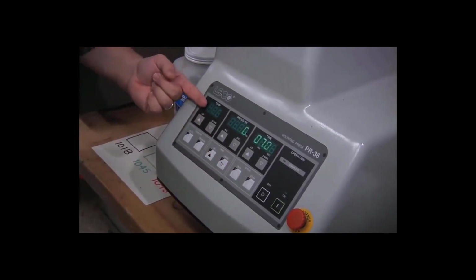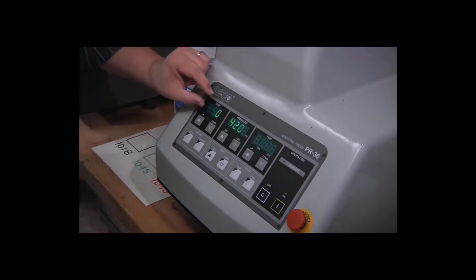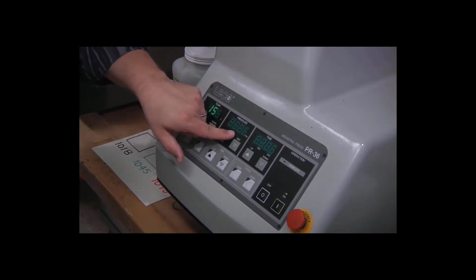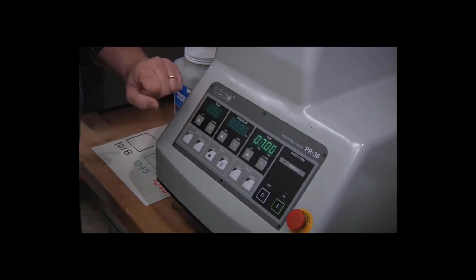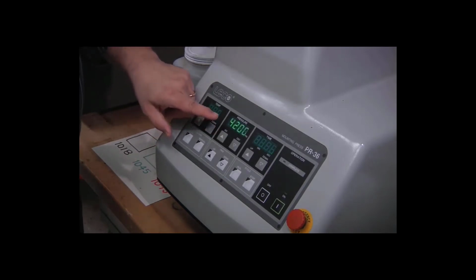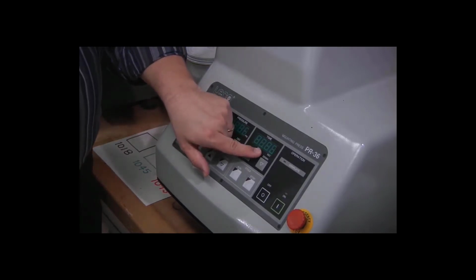It will bring the temperature up to 150 degrees. Once the temperature reaches 150 degrees, then it will maintain the pressure accurately at 4,200 psi. As the temperature rises, it will maintain pressure, but it doesn't hold the tolerance tightly until we've actually reached our 150 degree temperature. Once we've reached 150 degrees C and 4,200 psi, then the 7-minute countdown will begin.